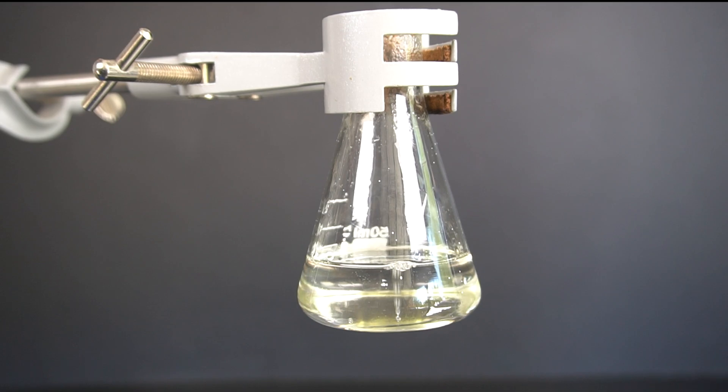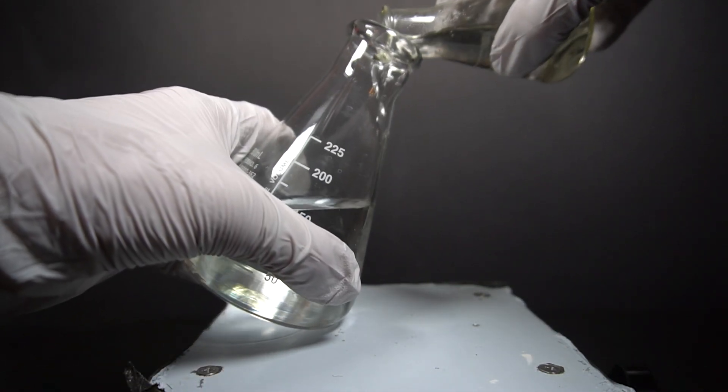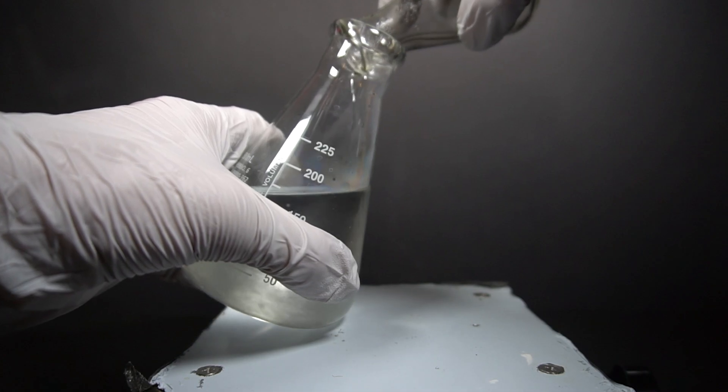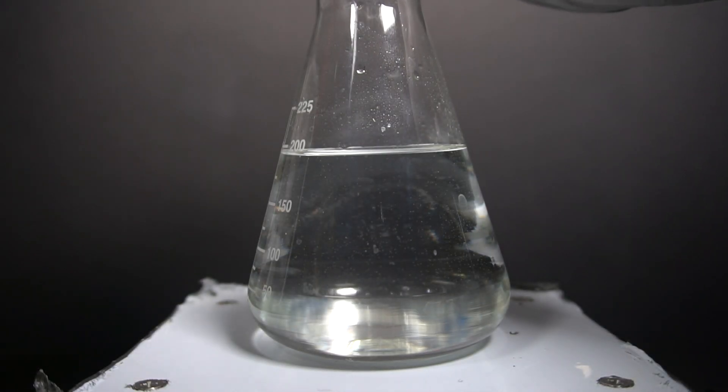I could dry it down in an oven or let it sit for about a month, but instead I'm going to show an additional amazing project that can be done with sodium silicate. We can add a variety of water-soluble metal salts and watch a really cool chemical garden start to grow. I decided to use copper sulfate, and I threw a few clean pieces in and waited.